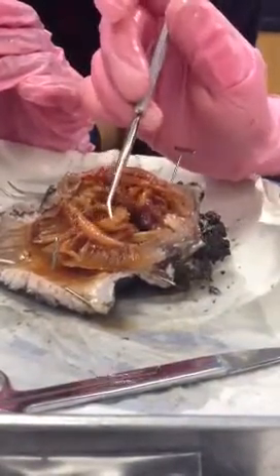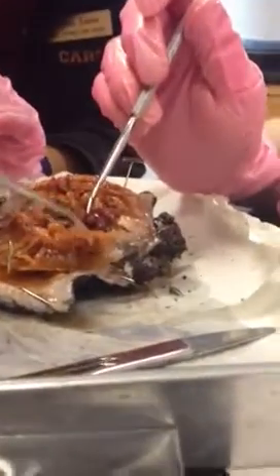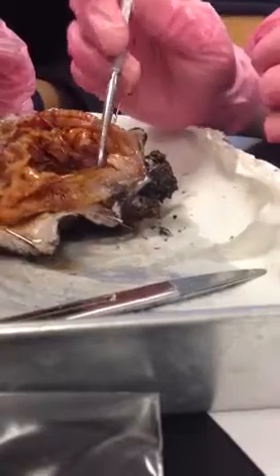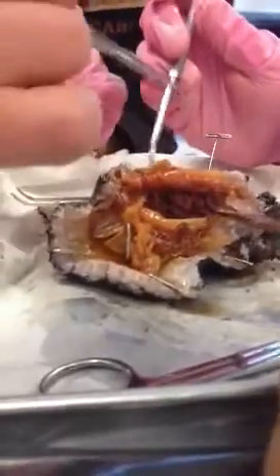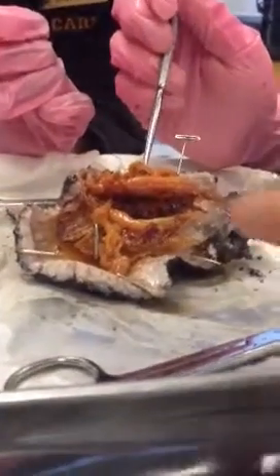Okay. What is this stuff? This yellow? I would say that looks still like... Here I'm going to say digestive, but I don't know. Because we thought that was the respiratory tree. Yeah, sure did. Because it kind of looks like a little leafy structure. Yeah. This does look like a respiratory tree. Yours looks good. Oh, wow. I don't know if you got one on the other side. Yep. I'm impressed. Usually they totally dissolve.